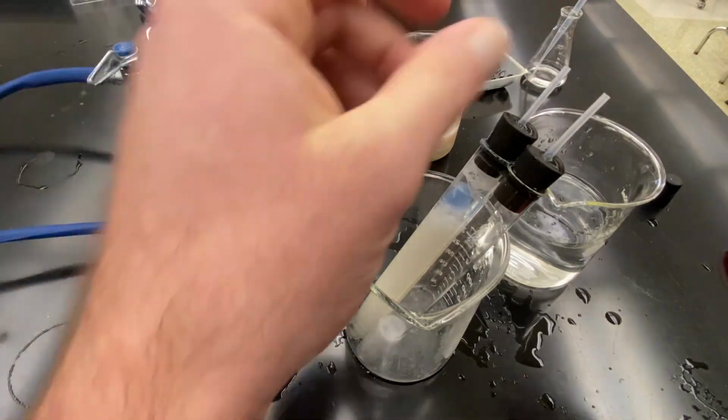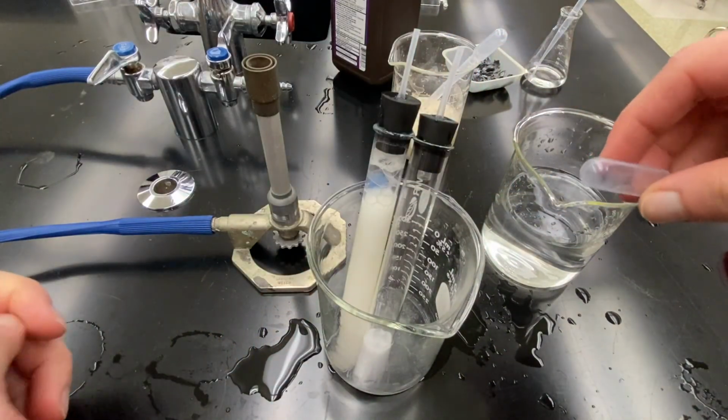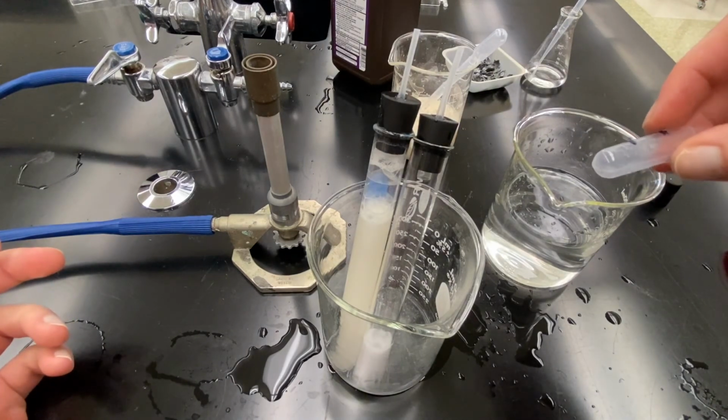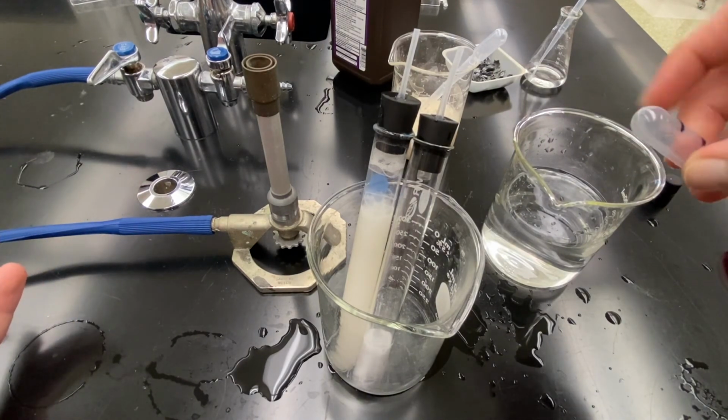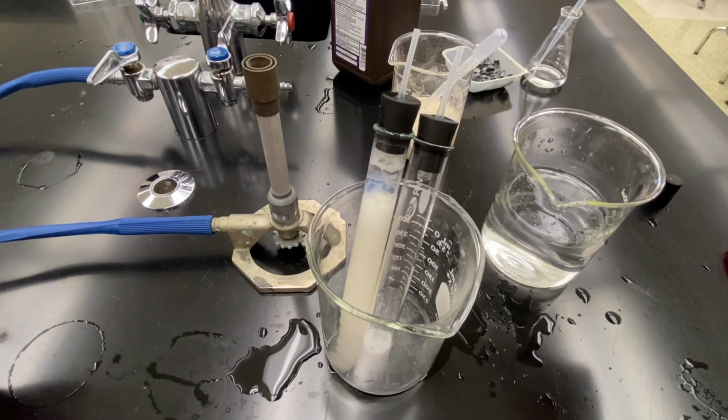So using the loudness of these combustions, we can make a determination as to the best way to combine these 2 gases and create a combustion reaction. So hydrogen and oxygen, what is the best ratio between them? So based on the loudest pop.